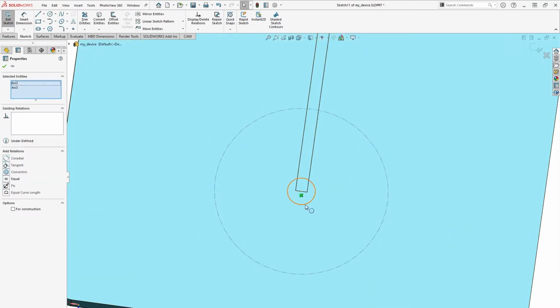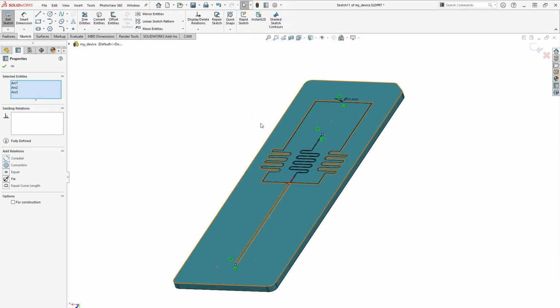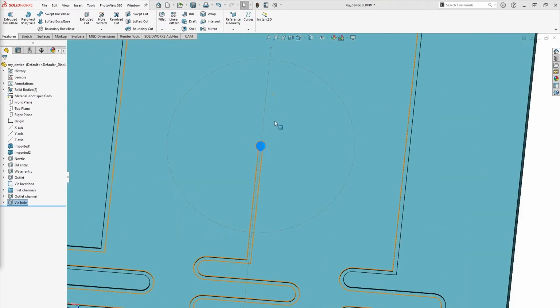A lot of customers who upload parts to our website leave their vias in this state. One of the big risks with machining is that sometimes tiny burrs can be left behind at the channel interface, potentially causing flow issues. We'll add a couple more features to help prevent burrs and improve alignment during the drilling process.